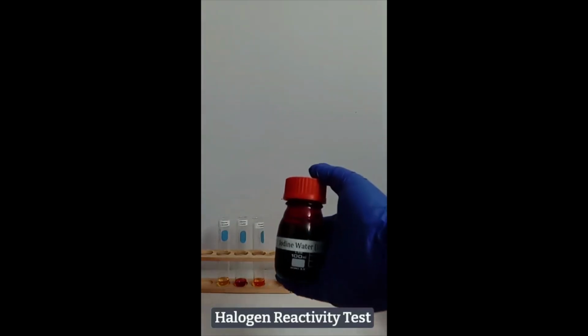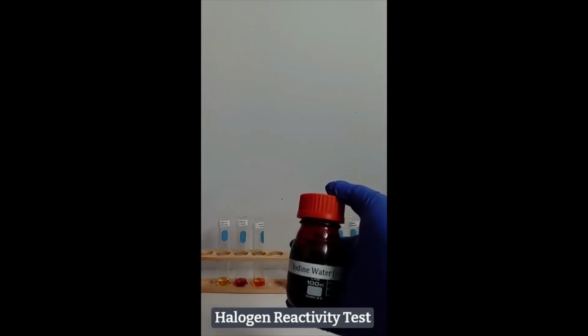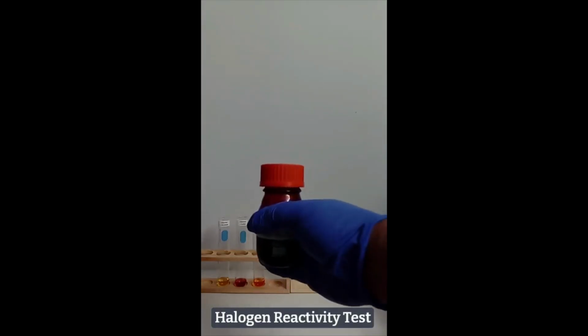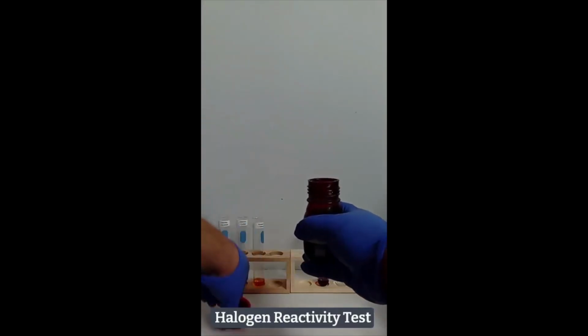Two milliliters of iodine water in potassium iodide are added to the last 2 test tubes.